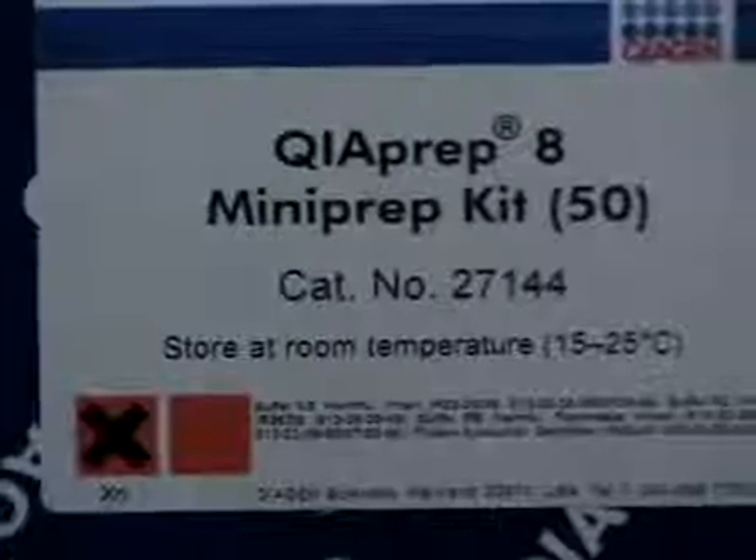I'm Shen Yuan from Mike Halen's lab, Department of Physiology and Biophysics, University of California, Irvine. Today I will show you how to use the Qiagen mini-prep kit to purify DNA from bacteria. I'm doing this as one step of a site-directed mutagenesis experiment. After I get the plasmid, I will sequence the insert to verify that selected clones contain the desired mutations.